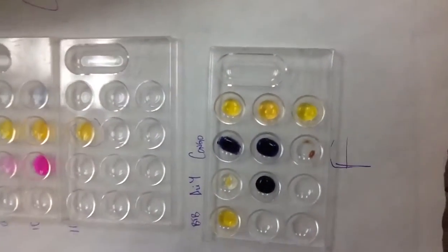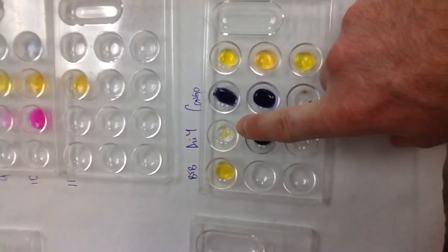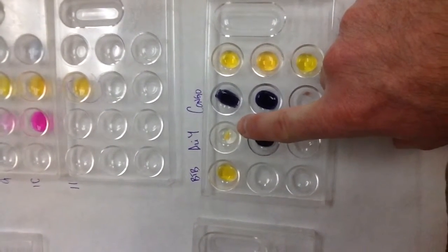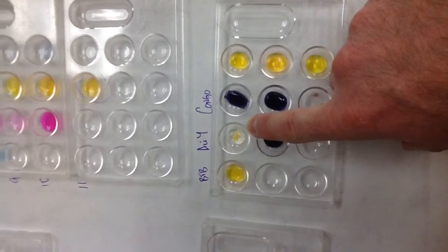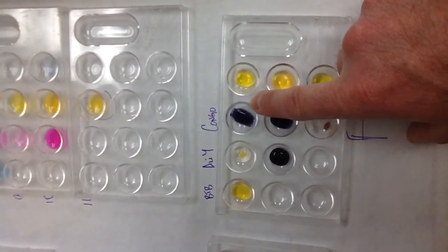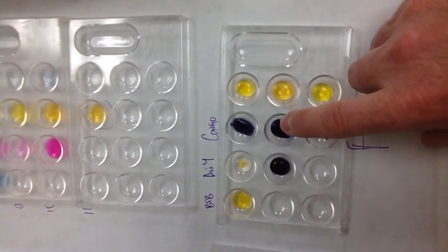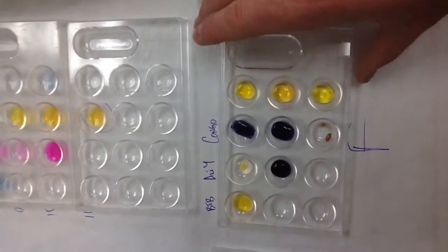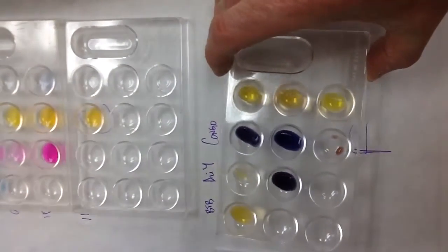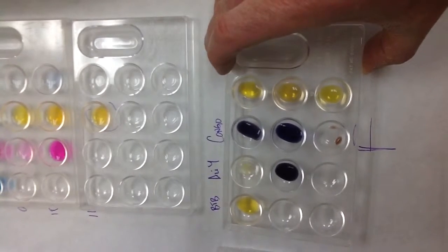Lastly, I've got sample F, and I've got bromothymol blue turning yellow, alizarin yellow giving me this yellow precipitate, so I know that the pH is 1 to 3. My Congo red is kind of a dark purple. So what I did here is I tested pH 2 and pH 3. They're both very dark, and on the screen it might be a little difficult to tell, but it matched pH 2 much better.